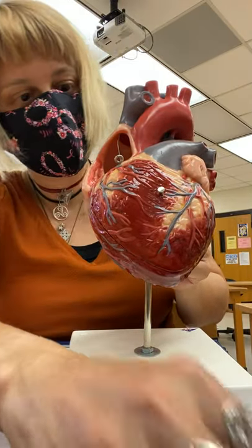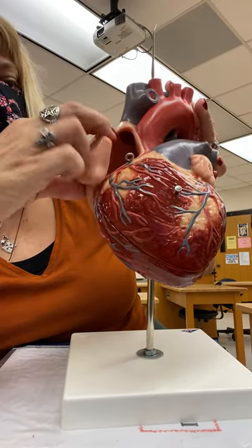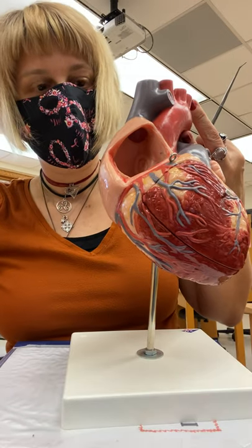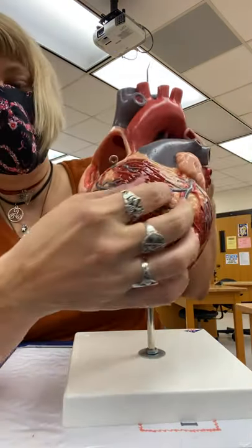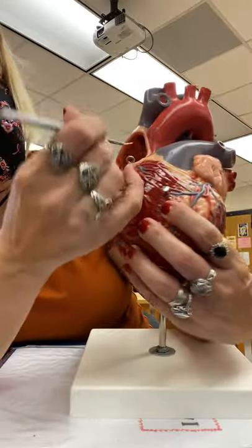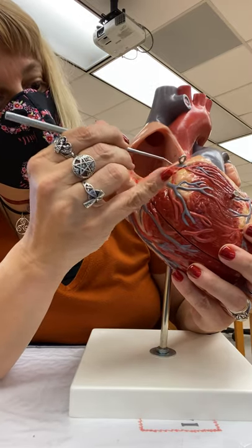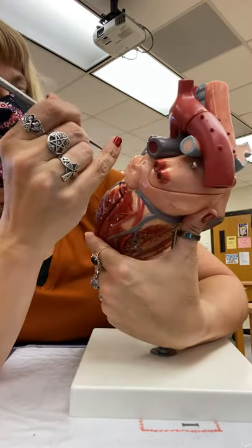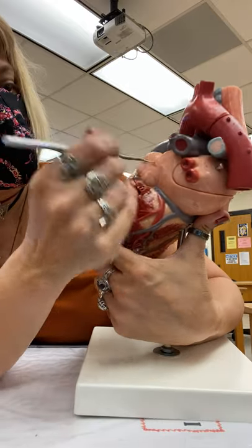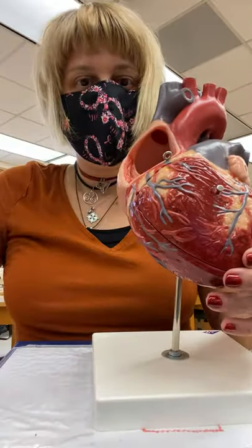Right auricle is on top — the auricle expands the right atrium. Before we take everything off, let's look on the outside and learn the coronary arteries. Just the main ones: this is the right coronary and the widow maker. The left coronary should be right about here, hiding just underneath this left auricle. Now I'm going to take this off.